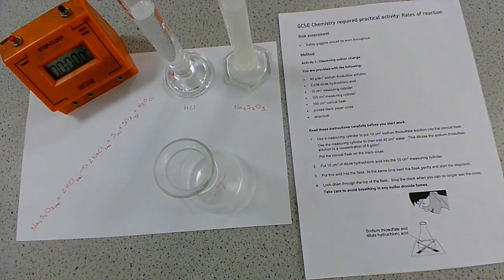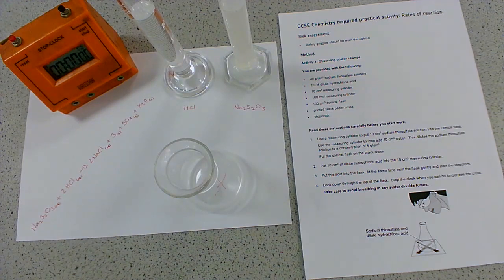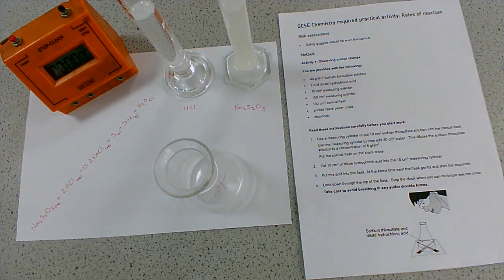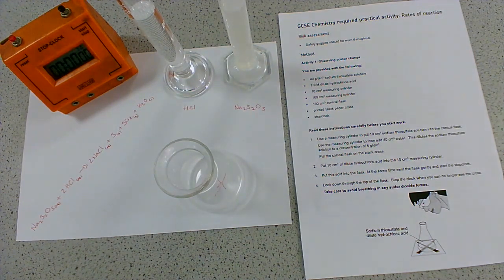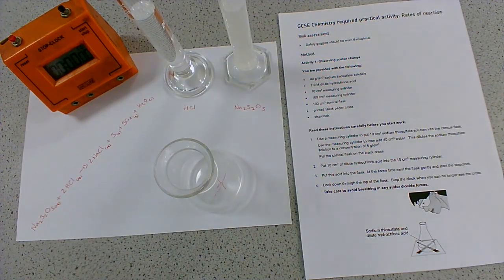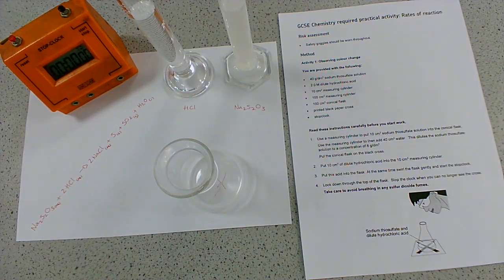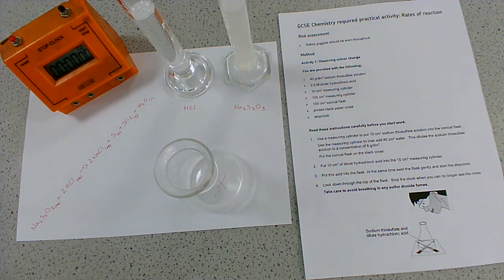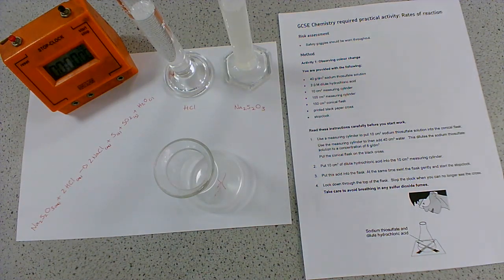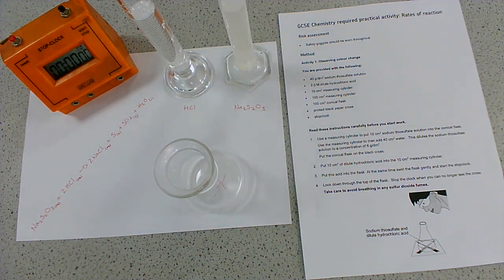This required practical is split into two activities. Both of them are going to be investigating the same thing - the effect of changing concentration on the rate of reaction. I'm not going to go through the full required practical here, just the method. If you repeated that method with different concentrations, you would be able to see the effect. I'll give you some data at the end so you can have a results table, calculate the average, plot a graph, and see the trend.